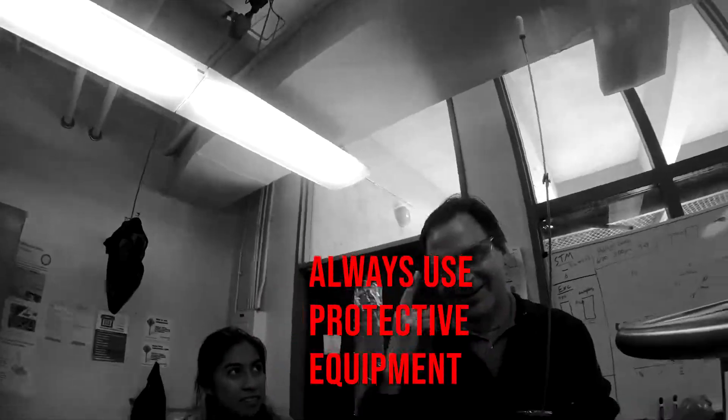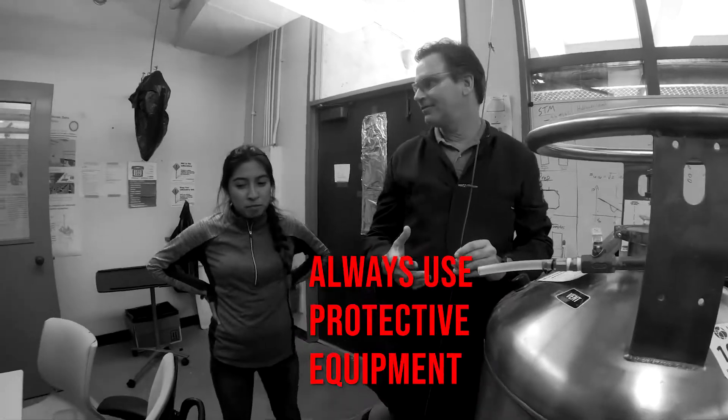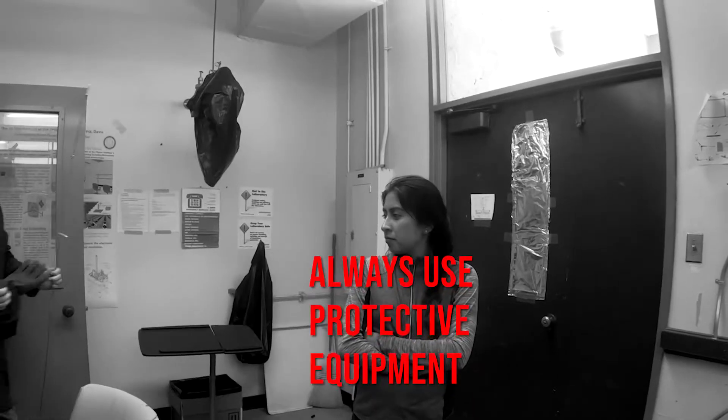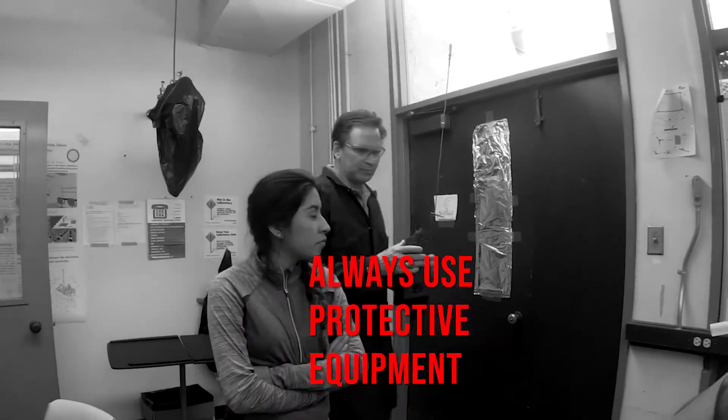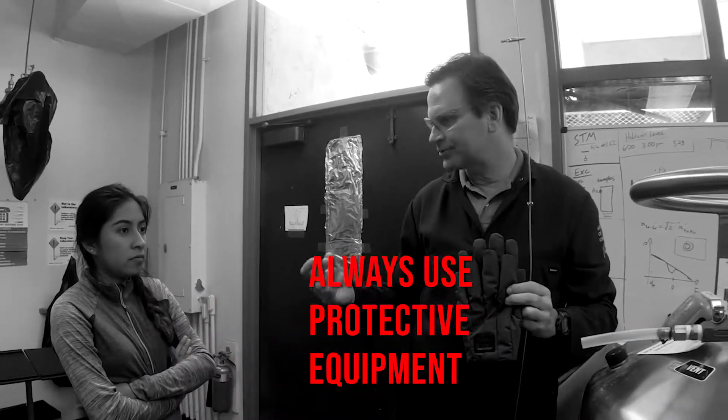You should have your PPEs on here. Safety glasses, cryo gloves. We've got cryo gloves, I think, somewhere. So very important. Cold gas can burn you, especially liquid helium. Coming out cold gas can give you frostbite.